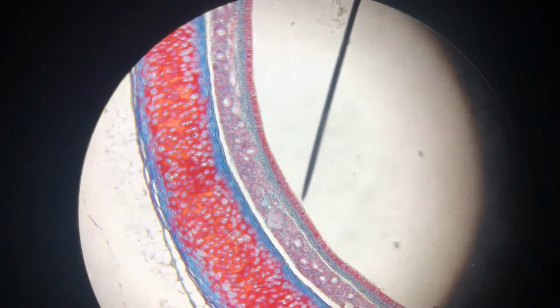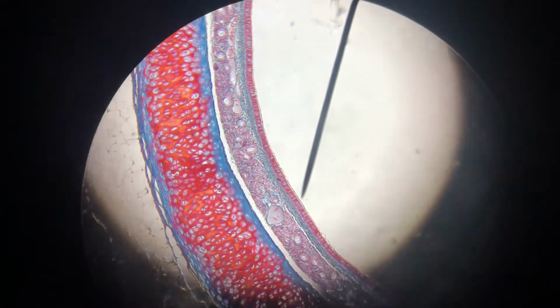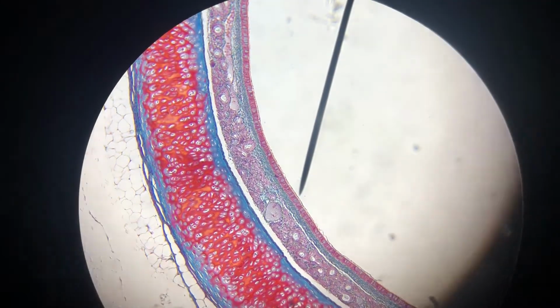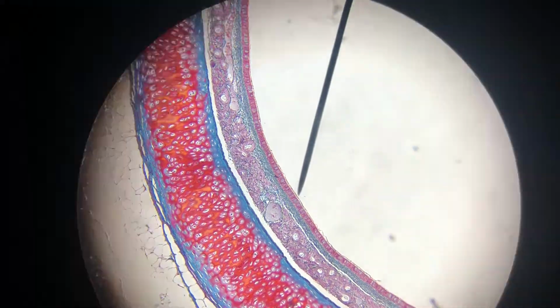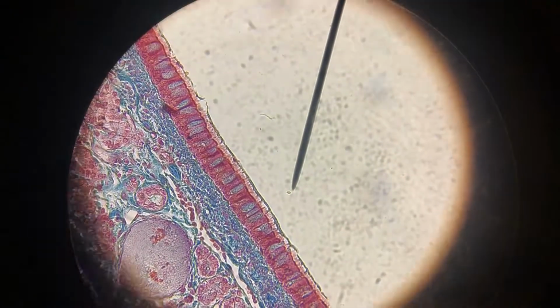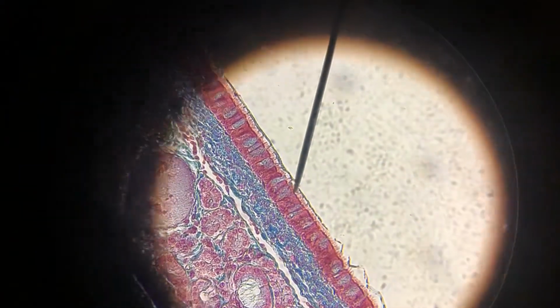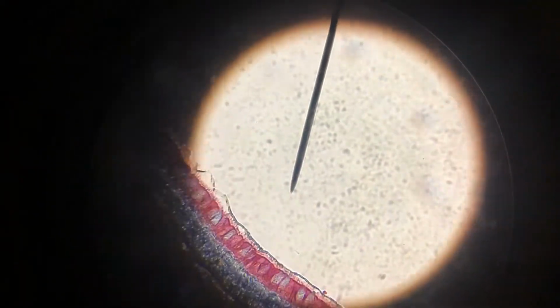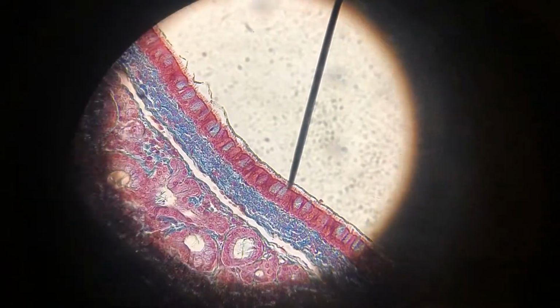So this is the trachea, and we can see lots of tissue types in it. There's actually some cartilage to the left. The pointer is indicating our mucosal layer, the pseudostratified ciliated columnar epithelium. So this is our last simple tissue, but it looks stratified. They call it pseudostratified because if you look, it's kind of hard to tell, but the nuclei of these cells are varying distances away from the apical surface.